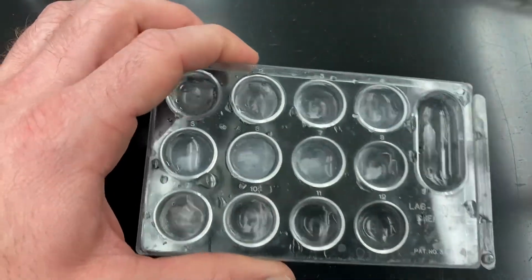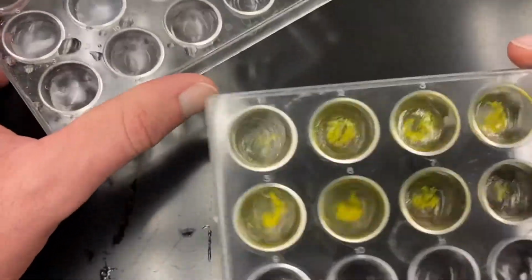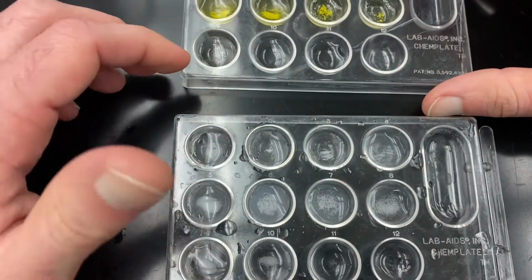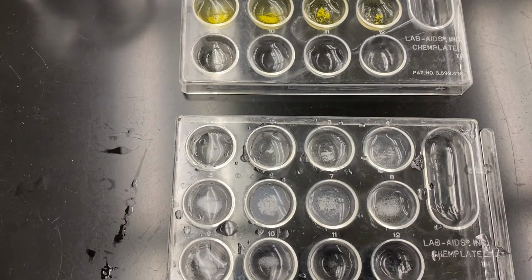And so by continuously combining these 2 substances, in this case lead 2 nitrate and potassium iodide, and then lead 2 nitrate and sodium oxalate, I could determine what the coefficients would be if I were to take these substances and write them out into a balanced equation. Those would be the coefficients for the reactants.